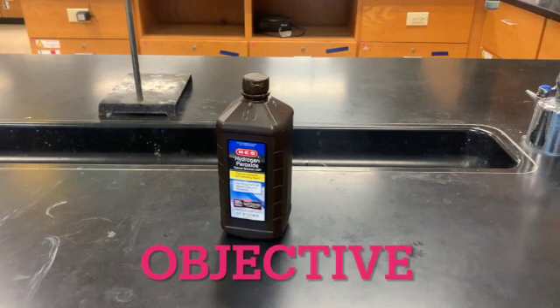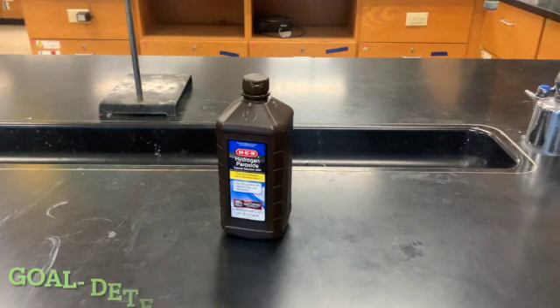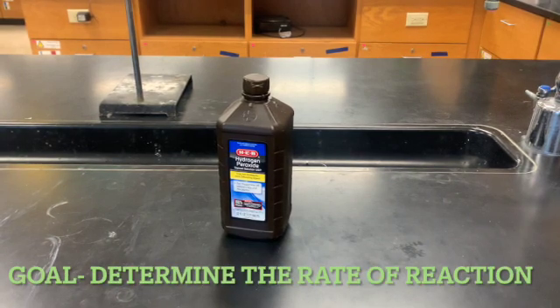Objectives. In this experiment, you will conduct the catalyzed decomposition of hydrogen peroxide under various conditions. You will calculate the rate constant for the reaction. You will determine the rate law expression for the reaction. You will calculate the activation energy for the reaction. Determine the rate of decomposition of hydrogen peroxide.